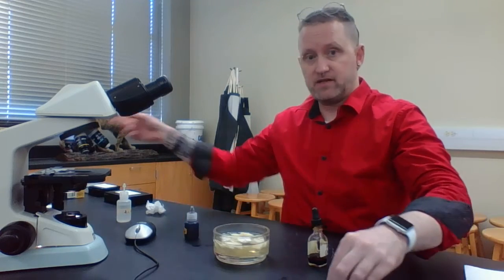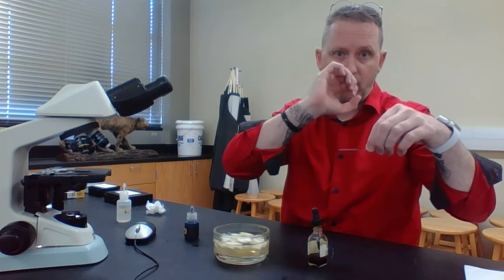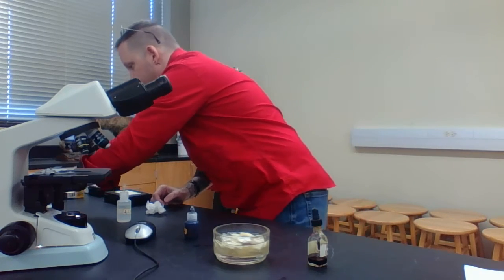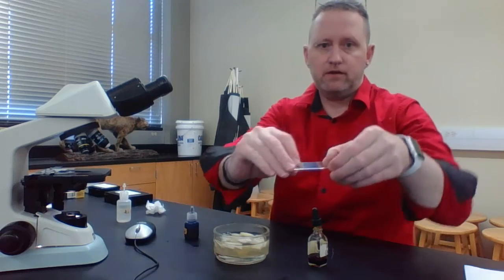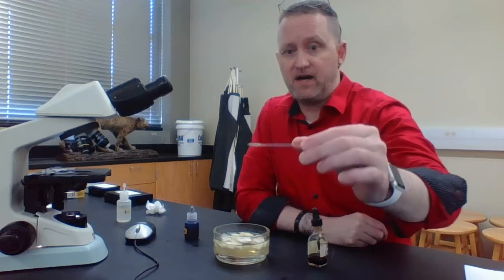Then come over here again and put that cover slip on your microscope slide. And then you're going to have something that looks like this. So again, this is the prepared slide I've done.